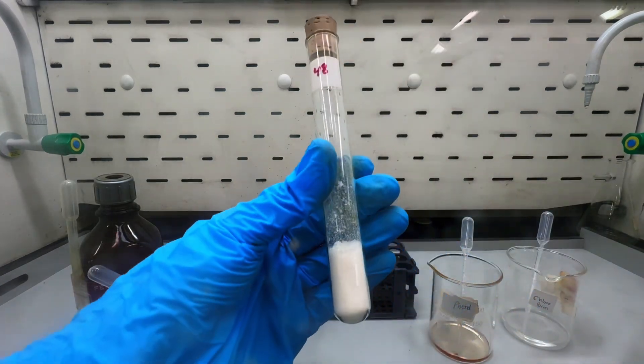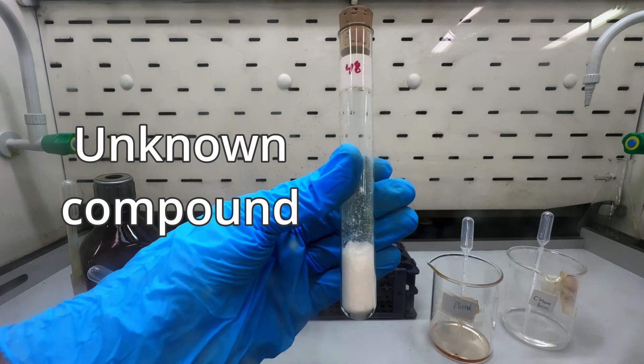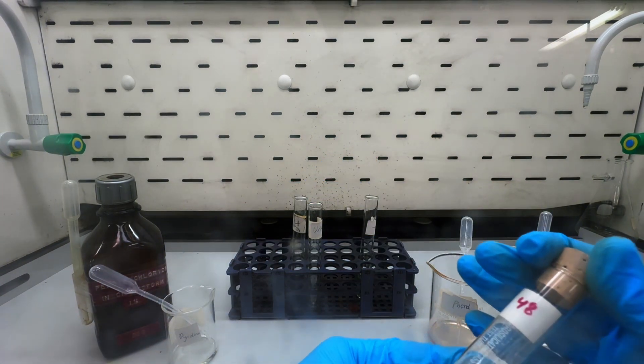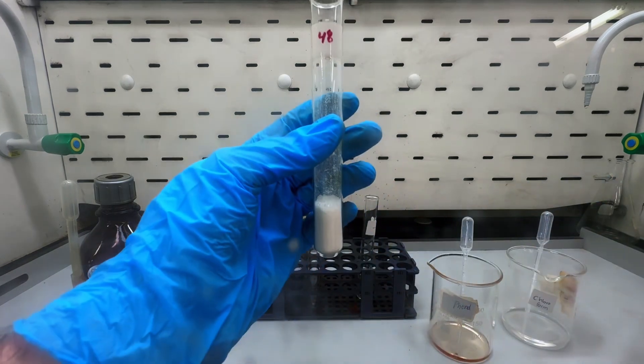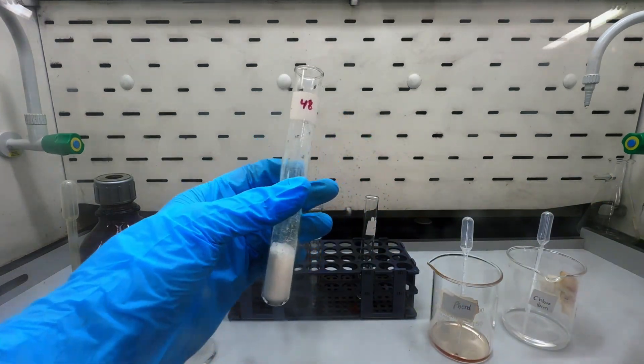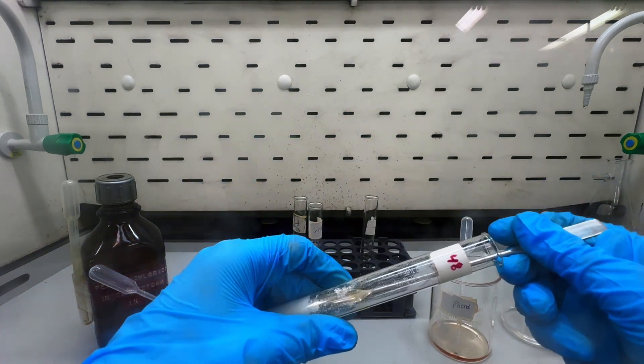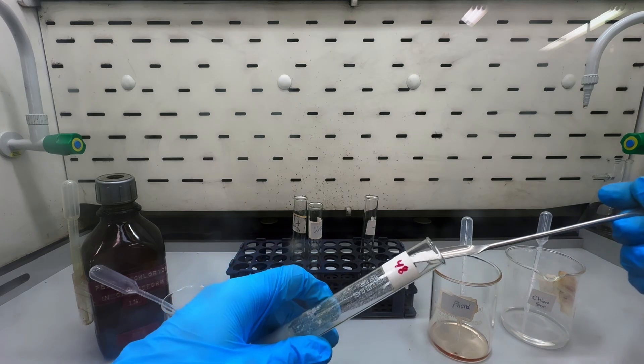Moving on to my unknown compound, the same procedure as both positive and negative controls is done, and only my final result will tell me whether my compound contains a phenol or not.